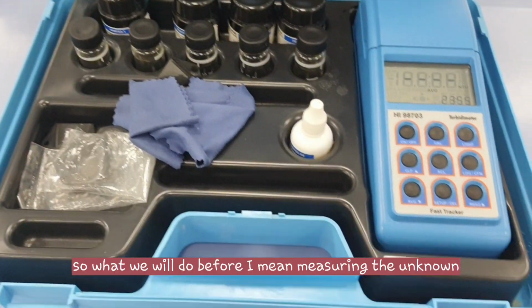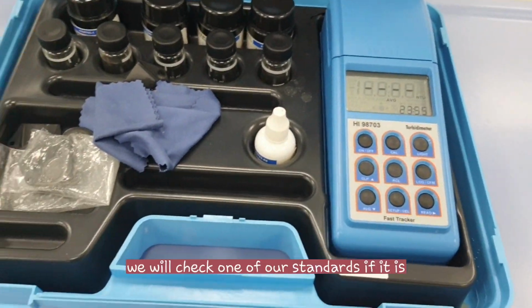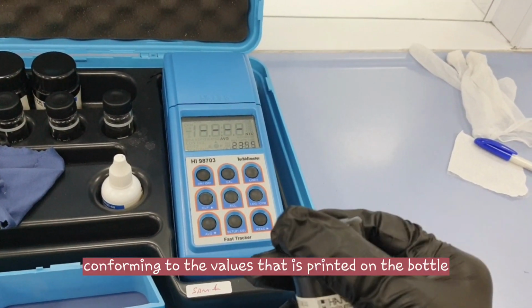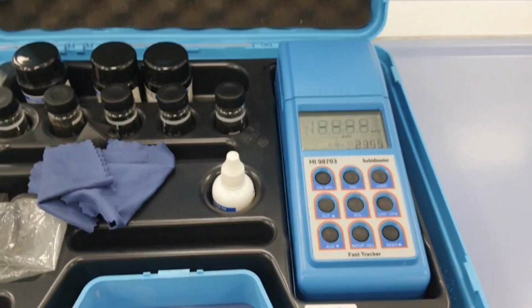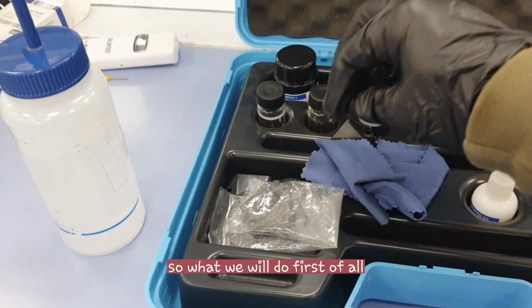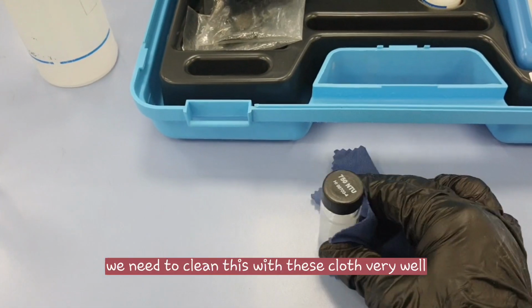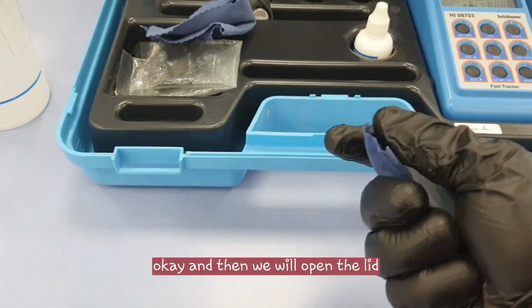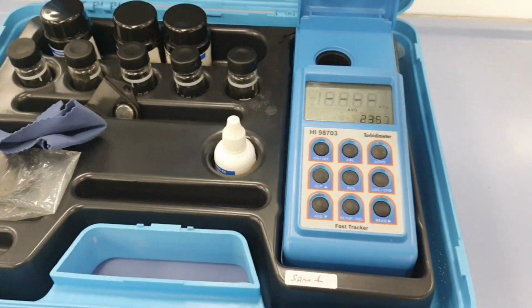Before measuring the unknown, we will check one of our standards to see if it conforms to the values printed on the bottle. So this is our standard. First of all, we need to clean the surfaces very well with this cloth, and then we'll open the lid.